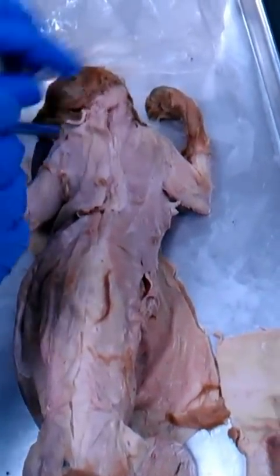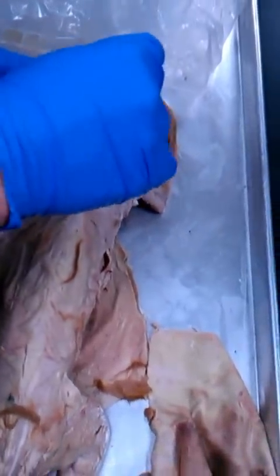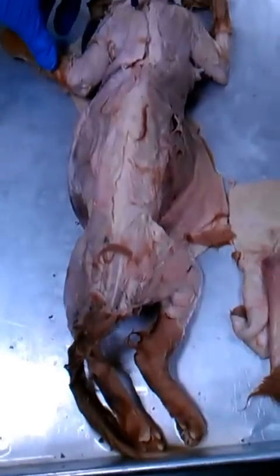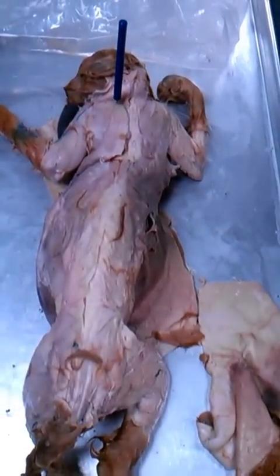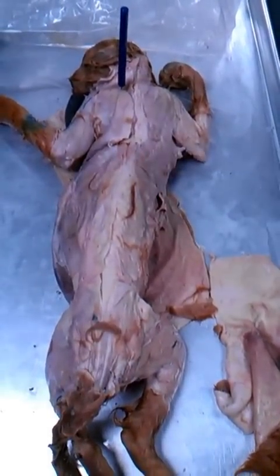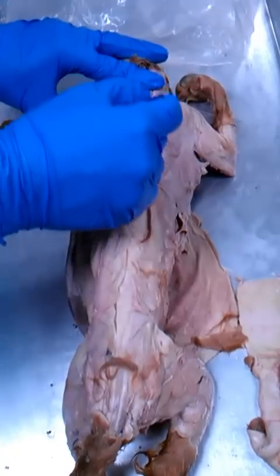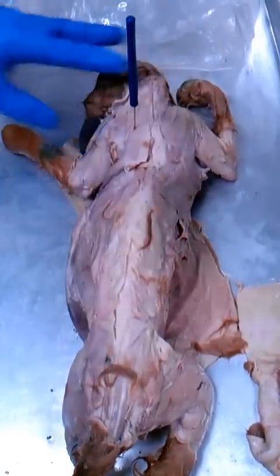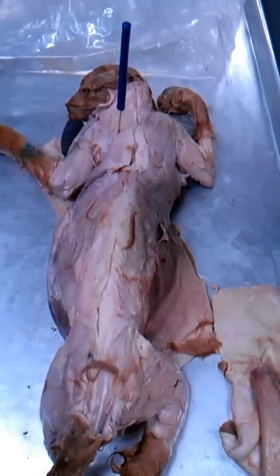Okay, from the shoulder basically straight across to the spine, so roughly there, that's the acromiotrapezius. Now, from the shoulder down at an angle like this, so if I pin it there, spinal trapezius. Looks the exact same place.